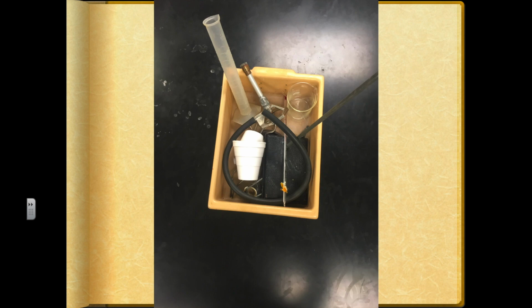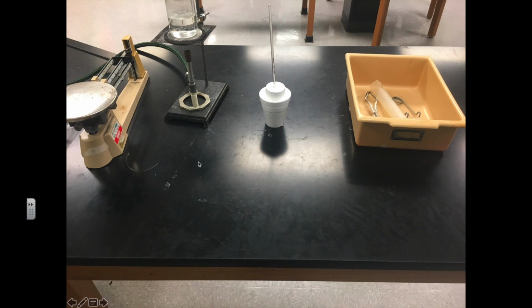We would use this equipment here, all stuffed in a bin, and if it's spread out, you would need to determine the mass of your sample. We would heat up our sample in some water, and we could measure the temperature of that water right there to monitor the temperature of the sample. Then we take that sample and drop it in a coffee cup that is also full of water, and we noted the temperature of this water before, and the water will heat up.